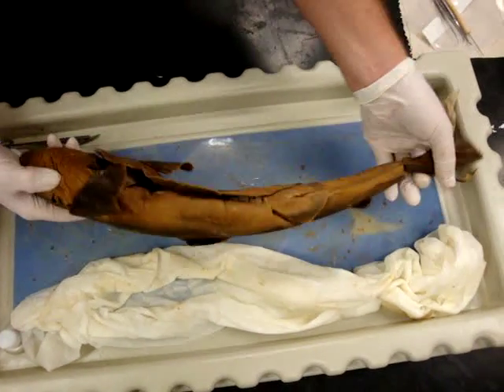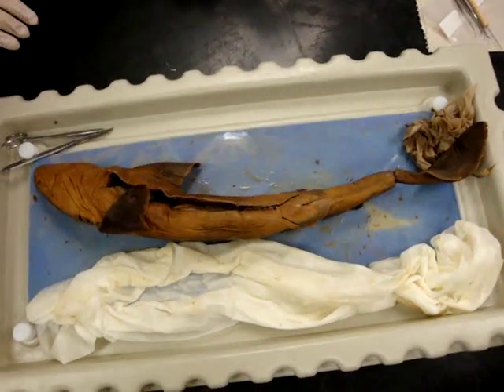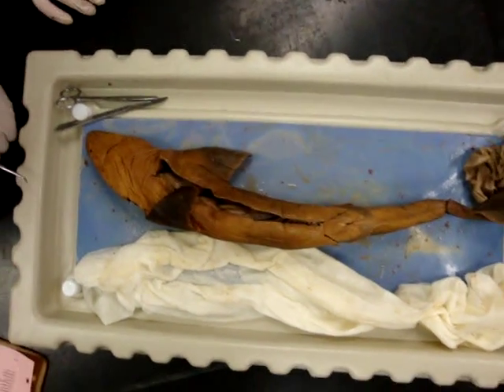This happens to be a female shark. She's probably three or four years old. She's in the pre-reproductive stage of life.